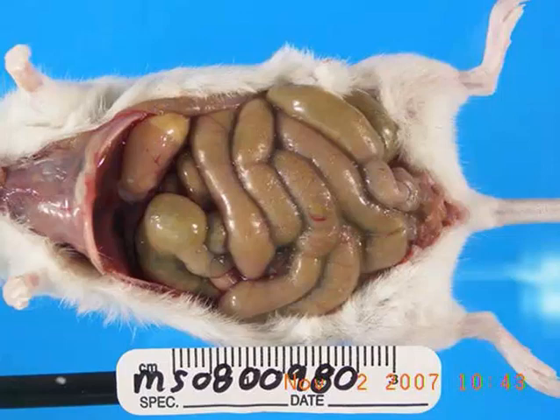Here's another dilated intestine in a white mouse. First, I'm going to think about a complication of intraperitoneal injection. Used to be pentobarbital, now it's Avertin, but any of those, when given intraperitoneally, are not only very irritating, but can also result in ileus.